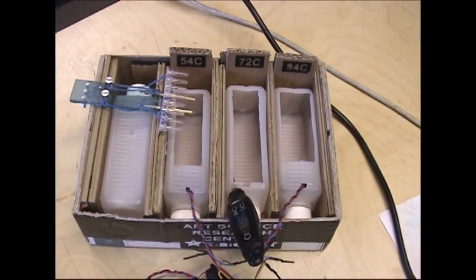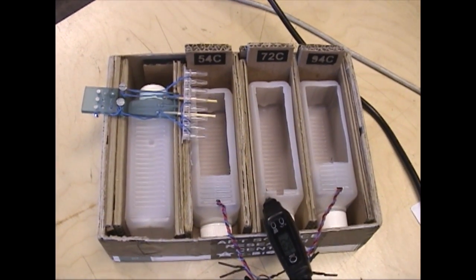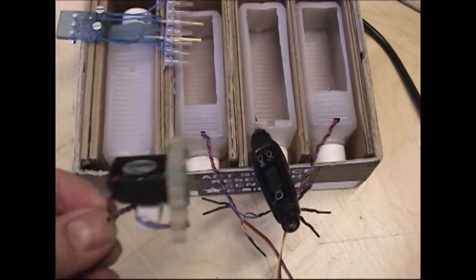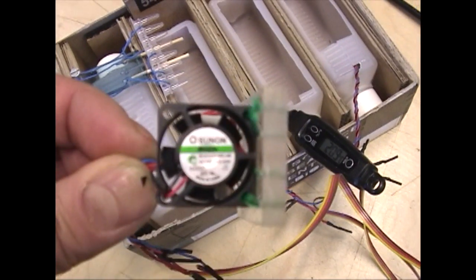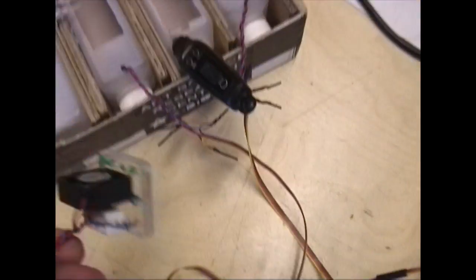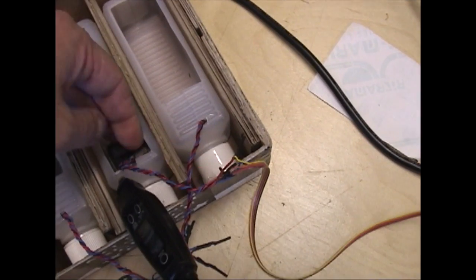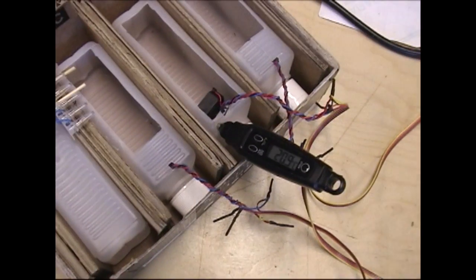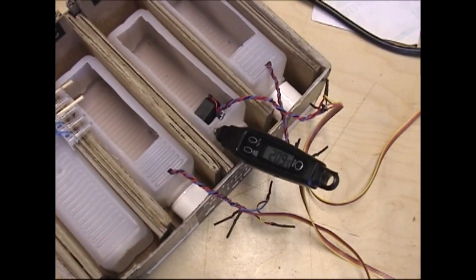our reaction chamber. In the reaction chamber there are essentially three bottles filled with mineral oil with some sort of simple element, consisting of two parts: a fan that mixes the oil and a power resistor that heats the oil. So it goes inside, puts here, and a thermometer is used to control the temperature of the oil.